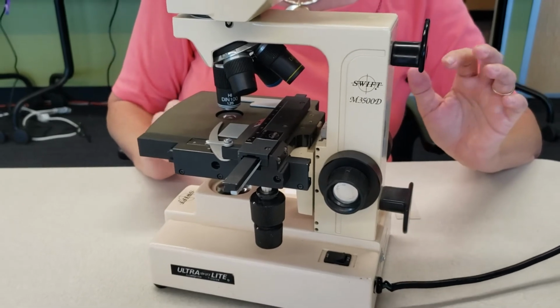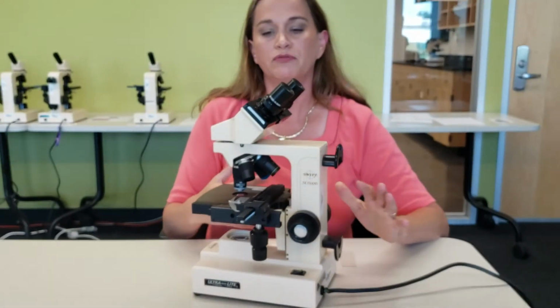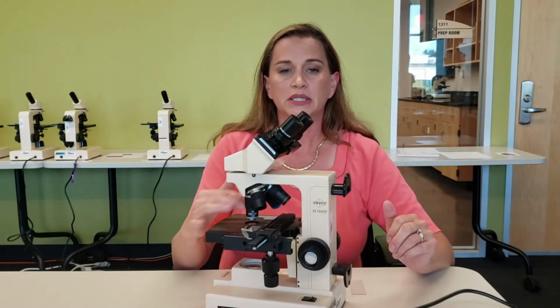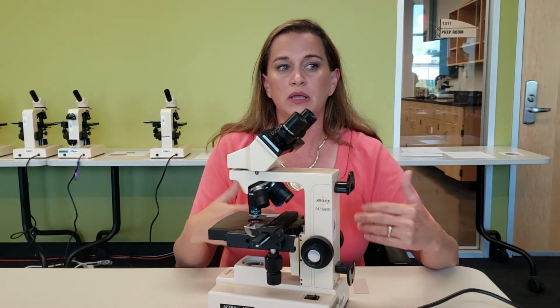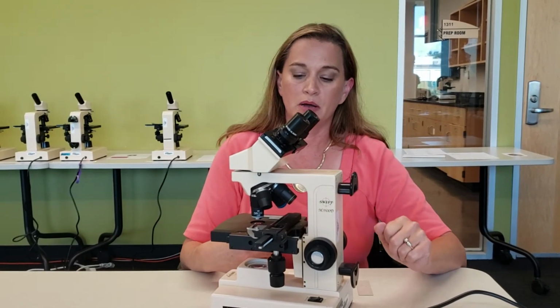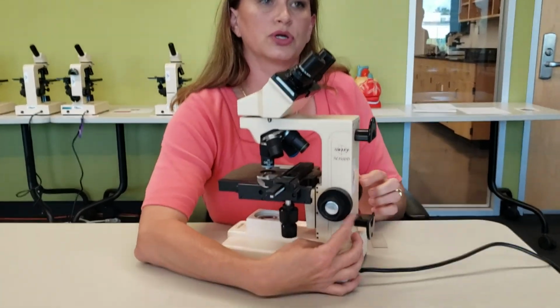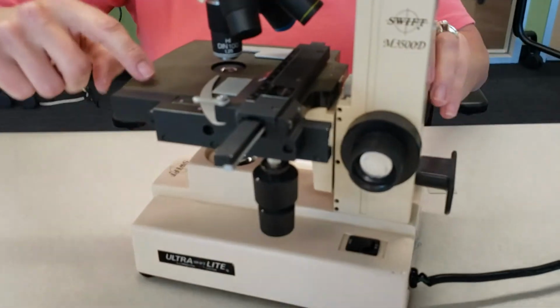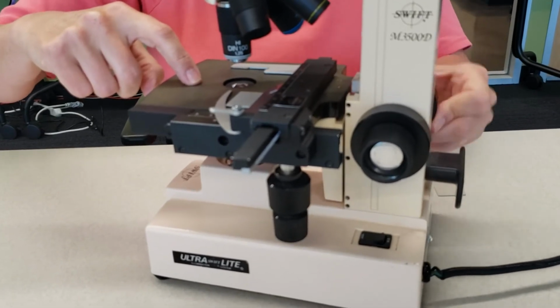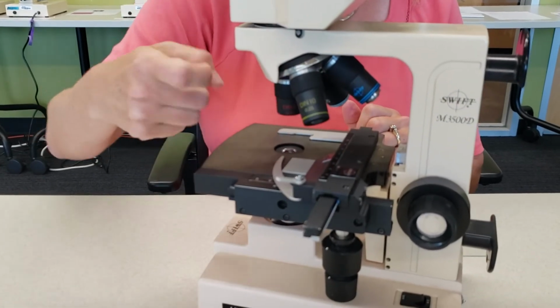When you are maintaining your microscope, at the end of the day, especially if you were in like microbiology, you'd want to clean your microscope, usually with an alcohol, to clean all the oil off your microscope, and then to remove any bodily fluids or bacteria. Then you would want to put your microscope up. To put your microscope up, you're going to lower your stage, so you're going to use this coarse adjustment knob here to move this stage all the way down, like so. Then you're going to move this scanning objective, which is the smallest one, to the bottom position.